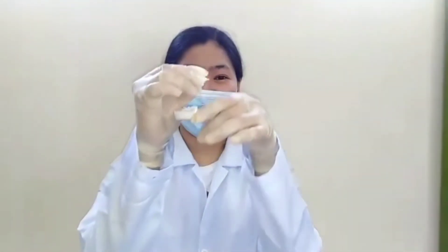As you can see, we have collected 23 grams of starch from the activity. We obtained 23 grams of starch from 263 grams of potato, or 8.75 grams of starch per 100 grams of potato. Just one large potato can therefore contribute to 30 percent of the adult minimum daily requirements of carbohydrates.